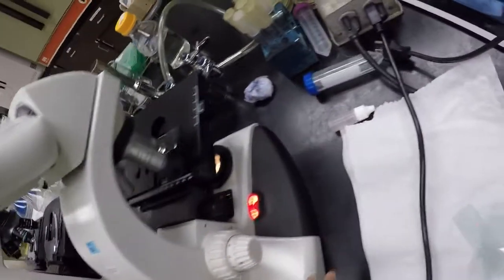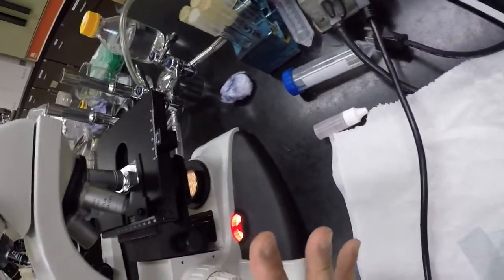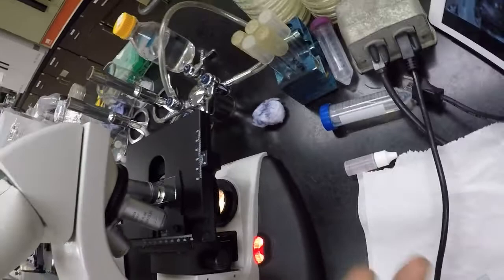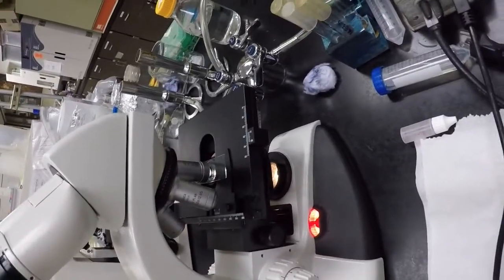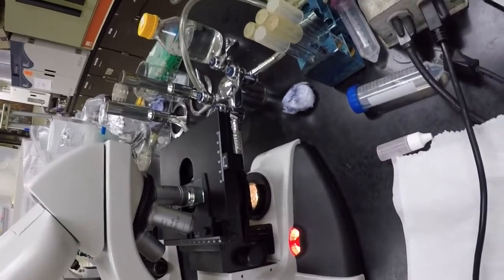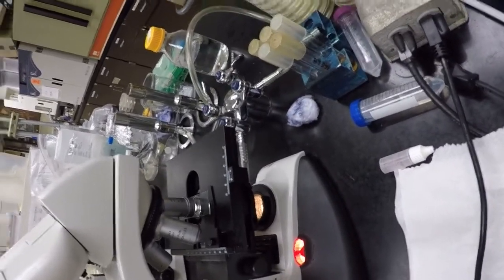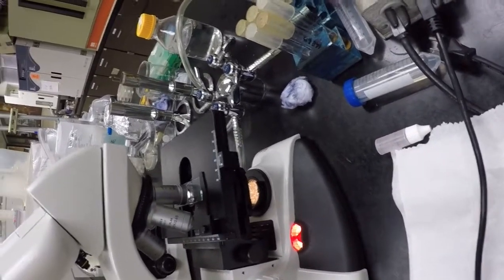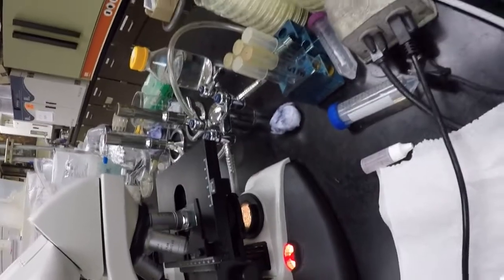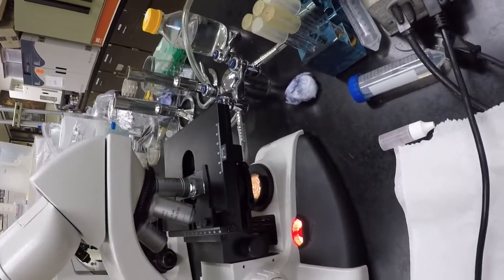So you shouldn't have to work too hard to get it. Now the important thing is that once you drop the oil on there, you cannot use any of the other lenses. Okay, because the oil only works with the oil immersion, not with any of the other lenses. So do not go back. If you absolutely cannot find it on the 100 times lens, do not go back and try to find it. It doesn't work like that. Okay? If you cannot find it on the 100 times lens, well, then you've kind of ruined the lens and you've got to start again. Okay? That's the basic rule of thumb.